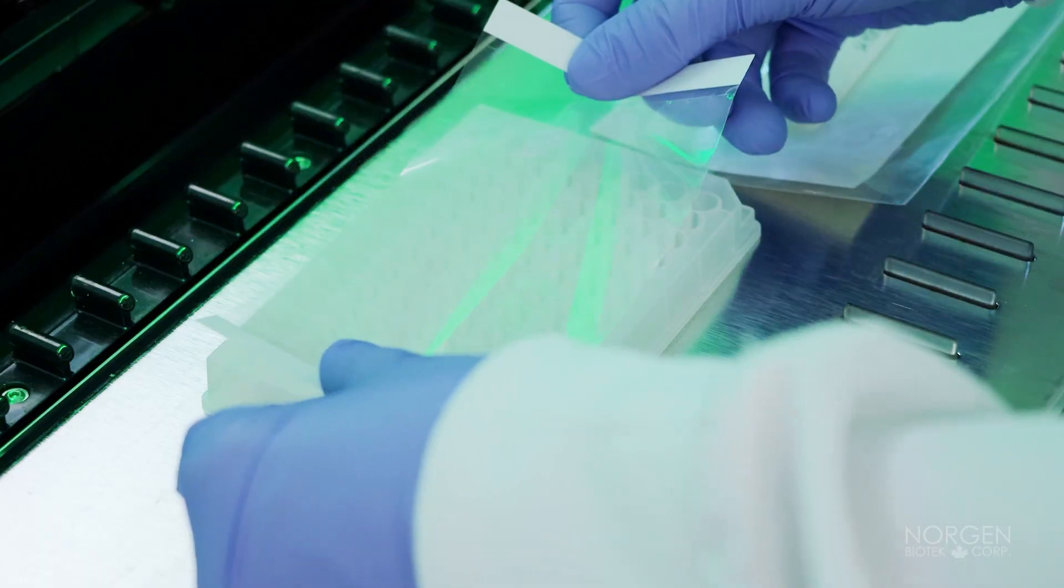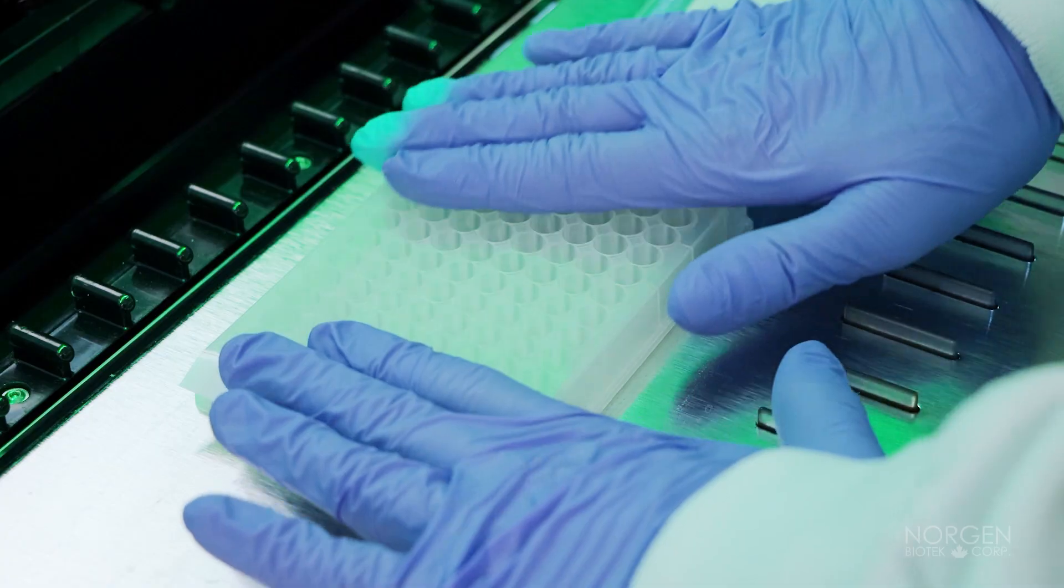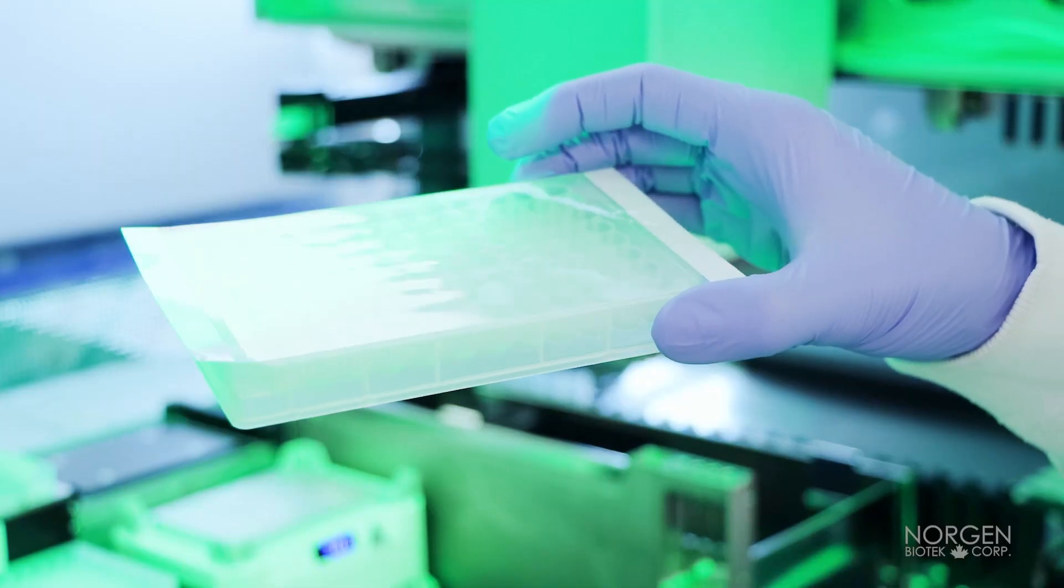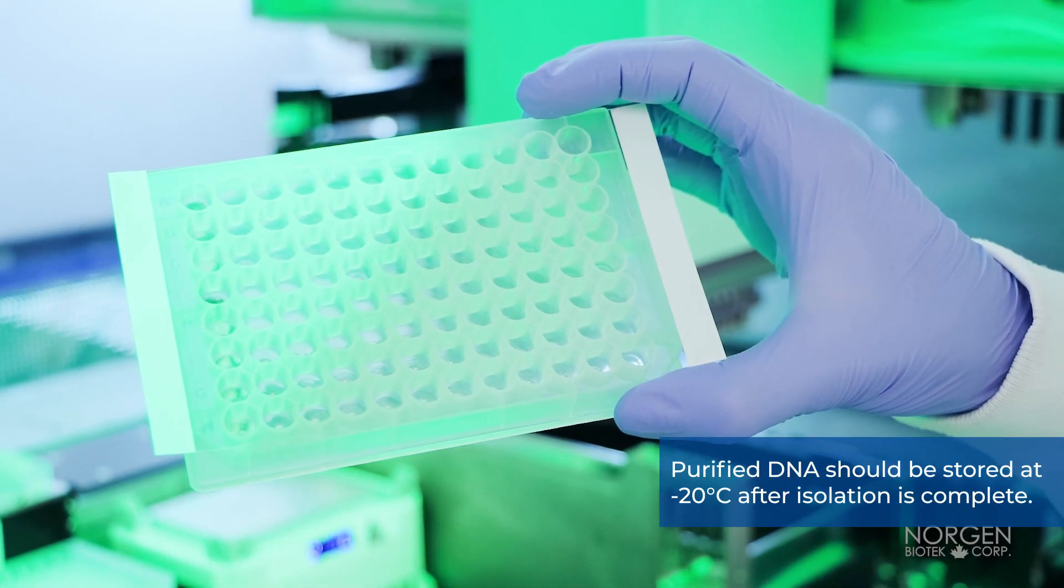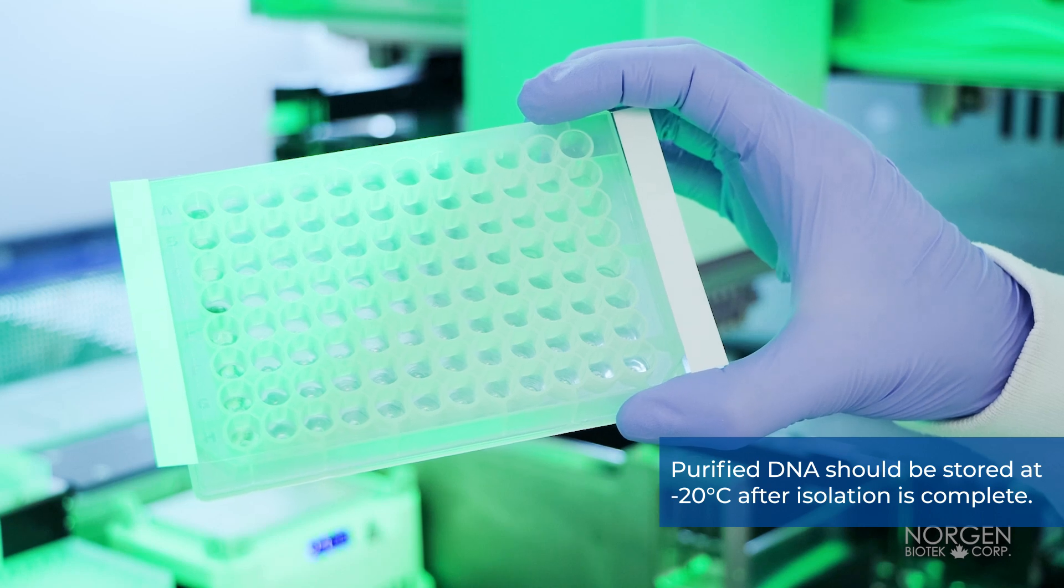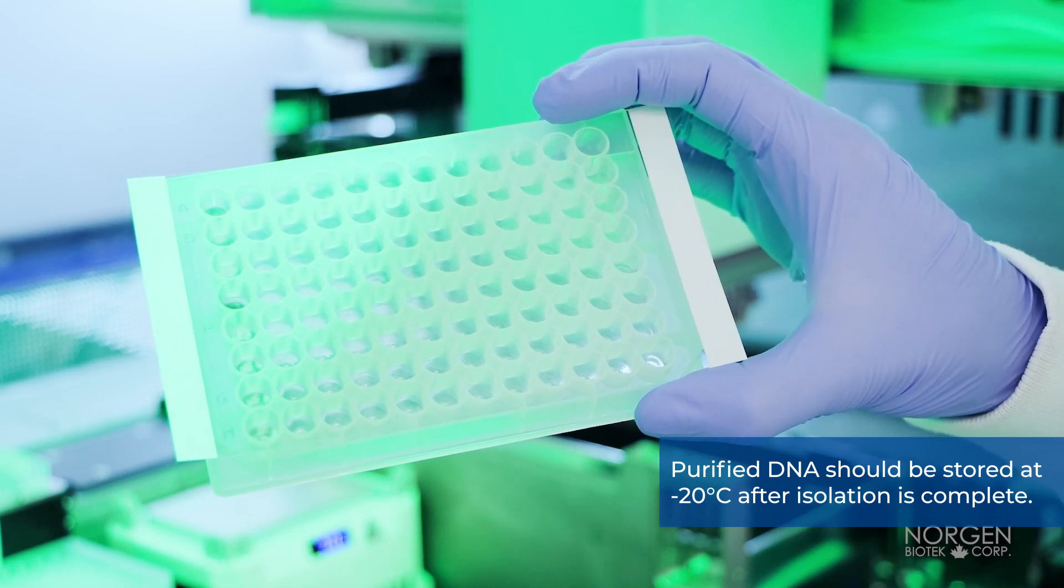The purified DNA in the elution plate can now be removed from the Hamilton Vantage and be used for downstream analysis. Purified DNA should be stored at negative 20 degrees Celsius after isolation is complete.